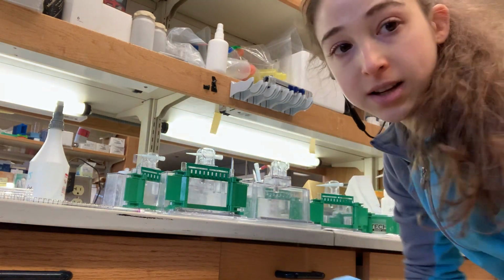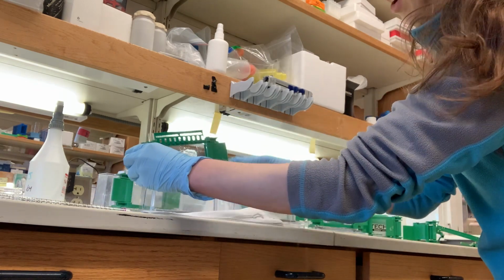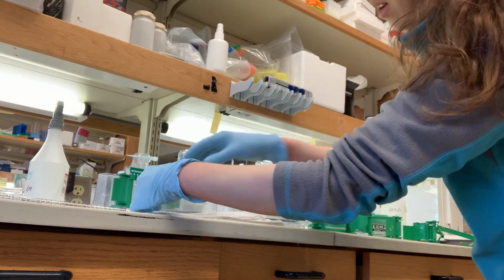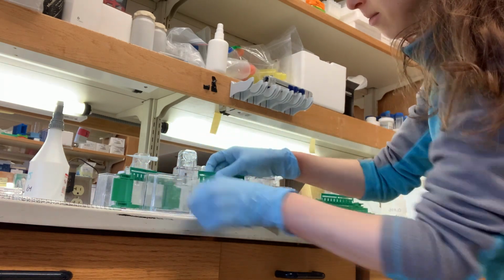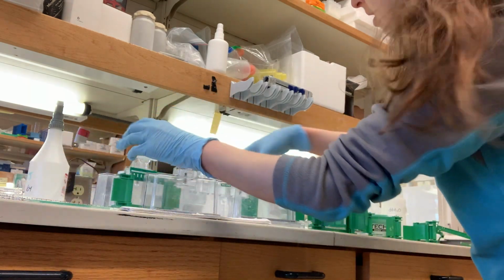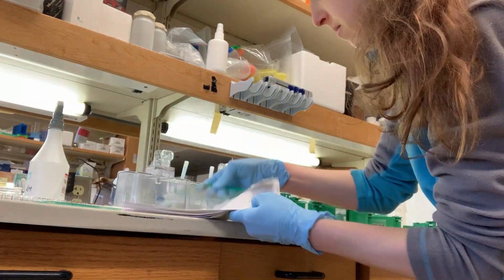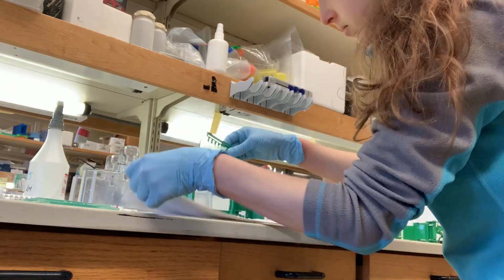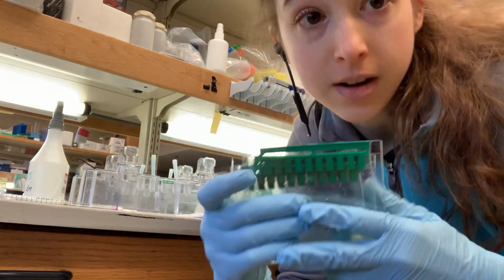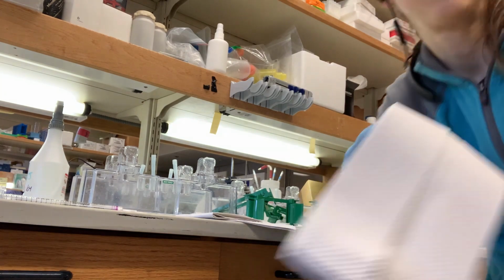But first you need to take the cassettes off. When you take it off, there's going to be gooey stuff, so do it on a paper towel. And then what I do is I wipe off the excess gunk. And then you just do that for all of them. So now I have my gels.